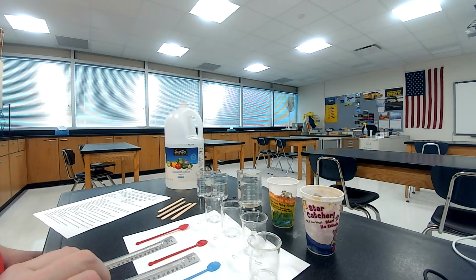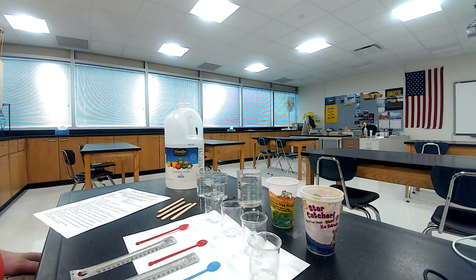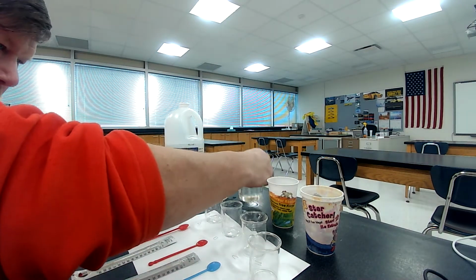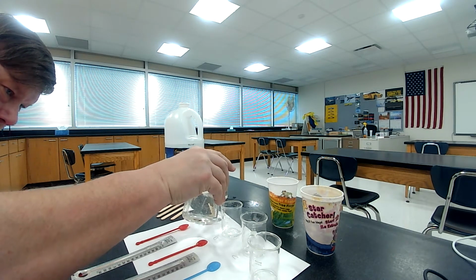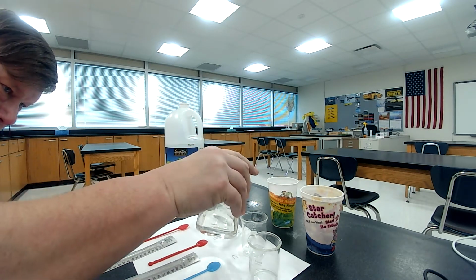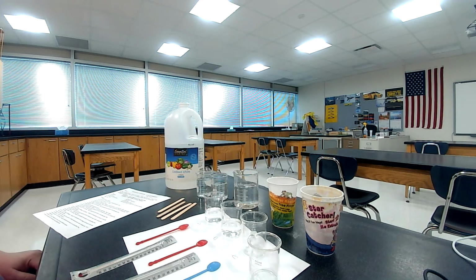It says on the procedure, and you can read this over with me as you go through this. It says, get all necessary materials, which I have. Fill the 250 milliliter beaker with 100 milliliters of room temperature water. I use 200 because I'd like to have some extra while I'm filming. Label 4 beakers A, B, C, and D. Okay, now it says pour 10 milliliters of water into A and B. So I'm going to just roughly put in here 10 milliliters. Again, these are marked not for exact measurements, for close measurements. Okay, I got 10 milliliters of water in there.